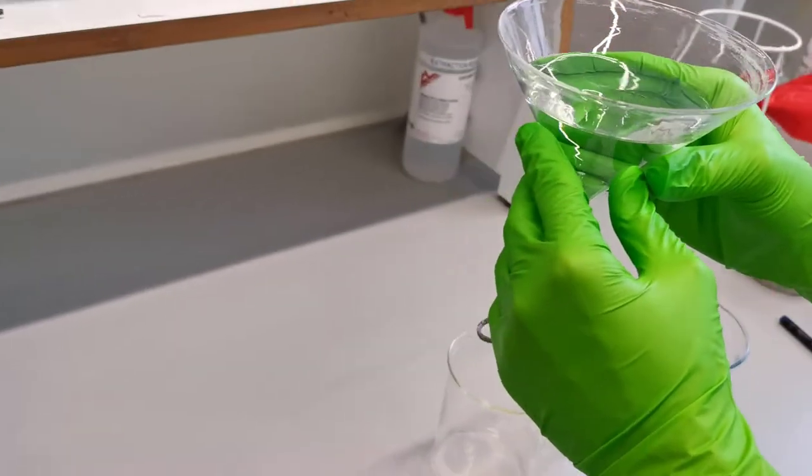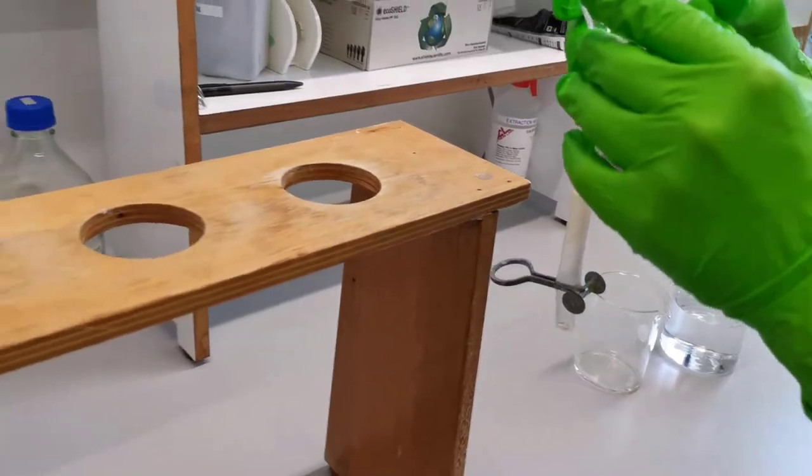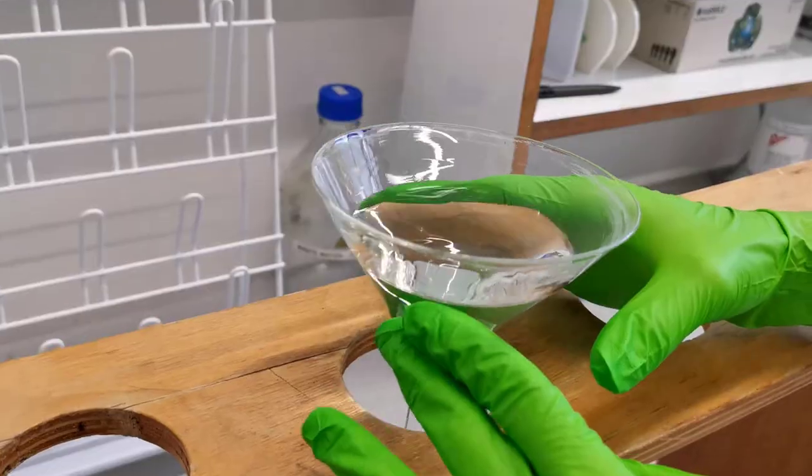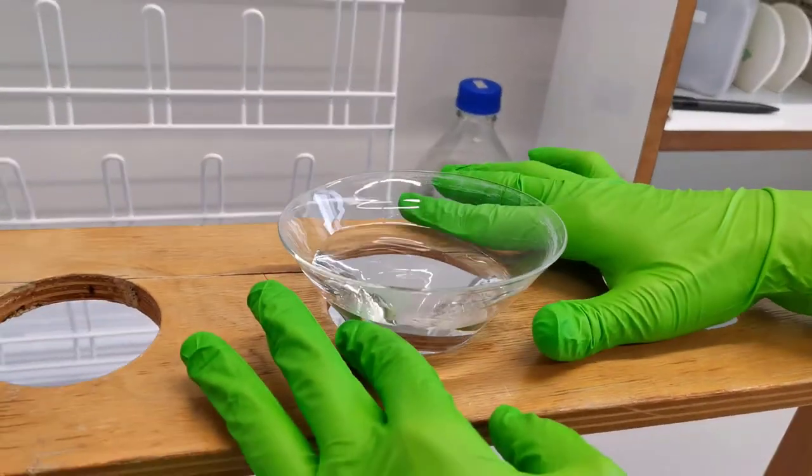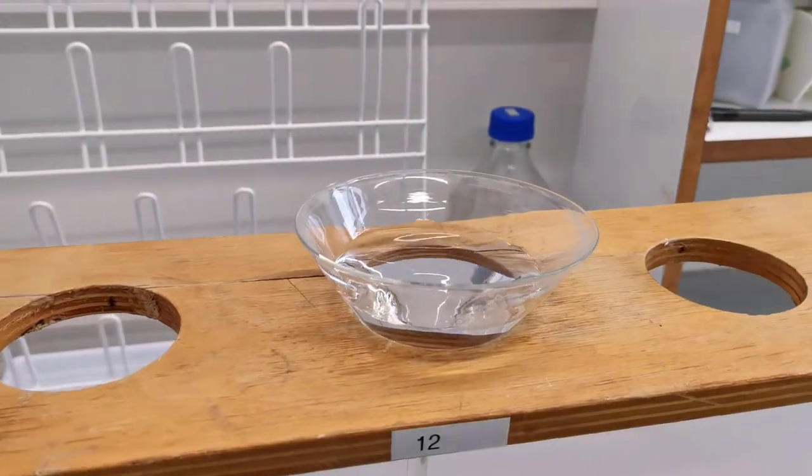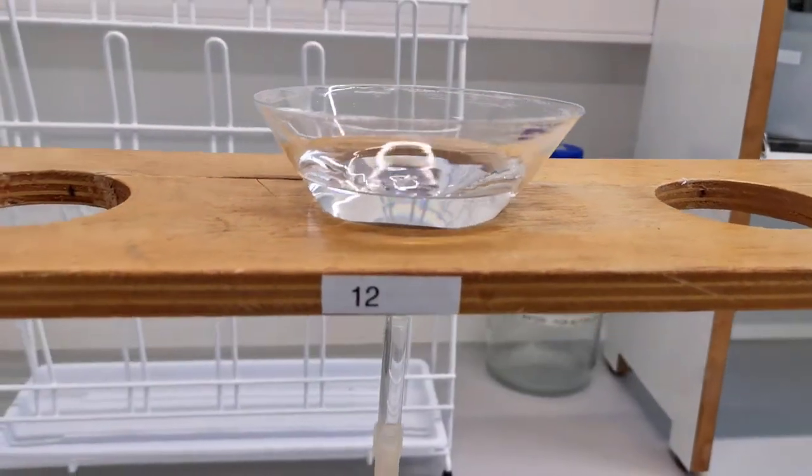Transfer the funnel containing some water to the structural support as shown, or you can also choose to add water to the funnel only after placing it on the support. And again, make sure water is not leaking at all.